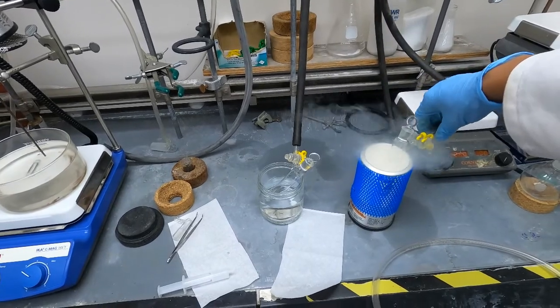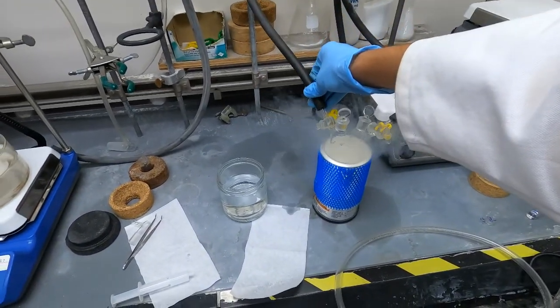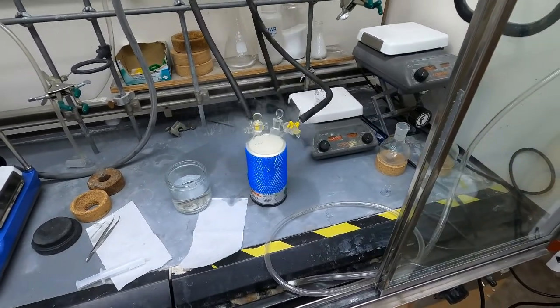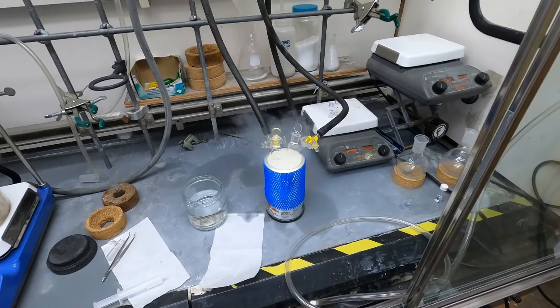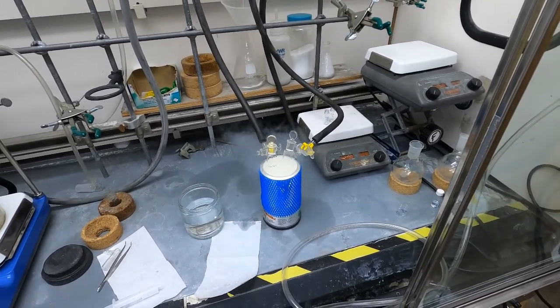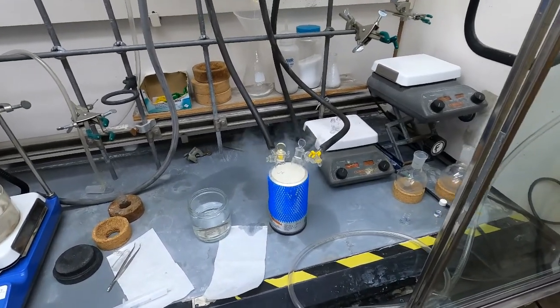I'm putting them into a dewar of liquid nitrogen and that's going to take a minute or two to freeze. The solvent of my reaction mixture is toluene and while we're doing that I'll explain how this works.